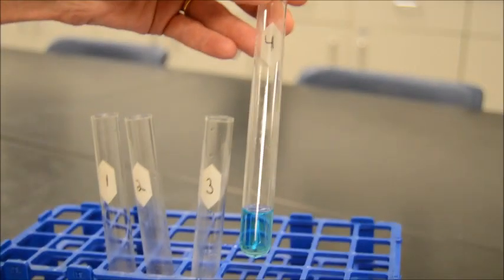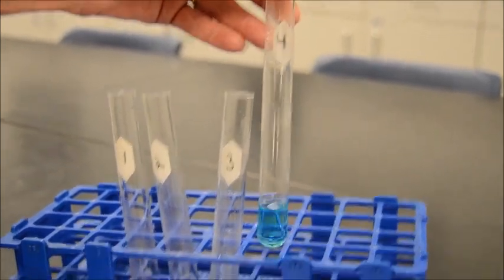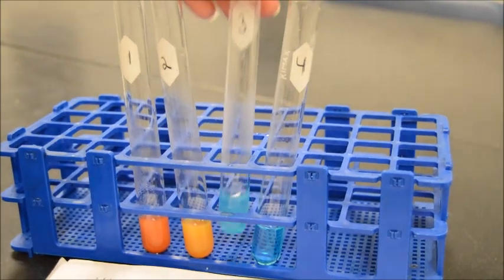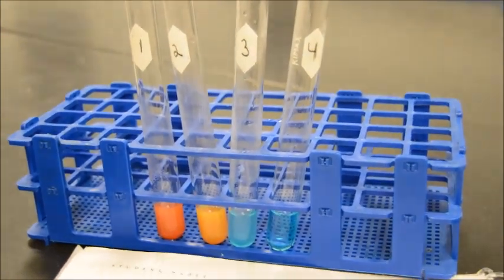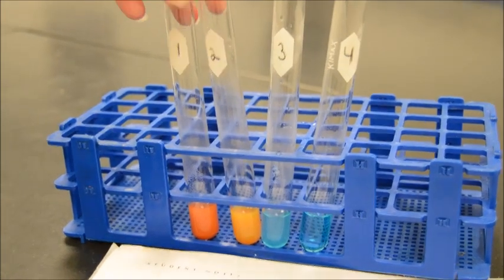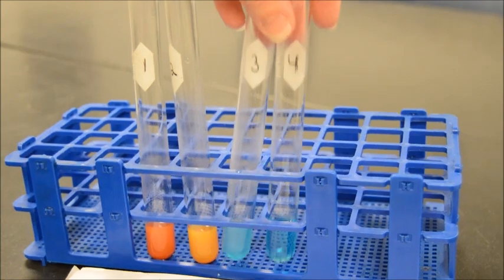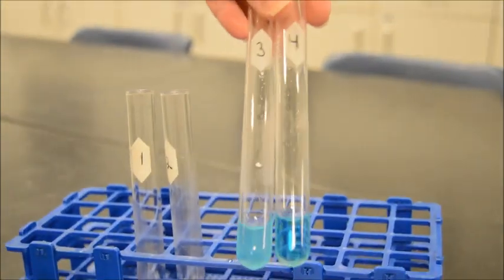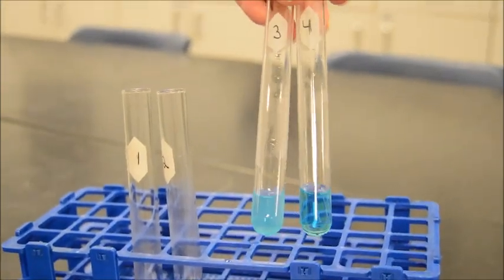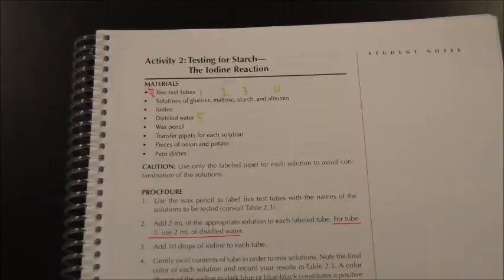And then, of course, we have number 4. This is our negative control, which is good old-fashioned distilled water. So it just looks like the reagent in water, which is literally what it is. That's it. All right, so there they are, 1, 2, 3, and 4. You can see 2 color changes. Not quite the same, but still positive. They don't all have to be identical. And then 2 without a color change. Notice they don't look exactly the same, but they both are the negative color. And that's got it. All right, folks.